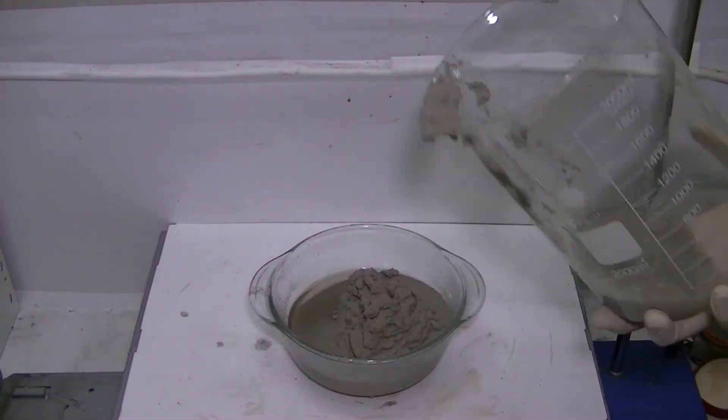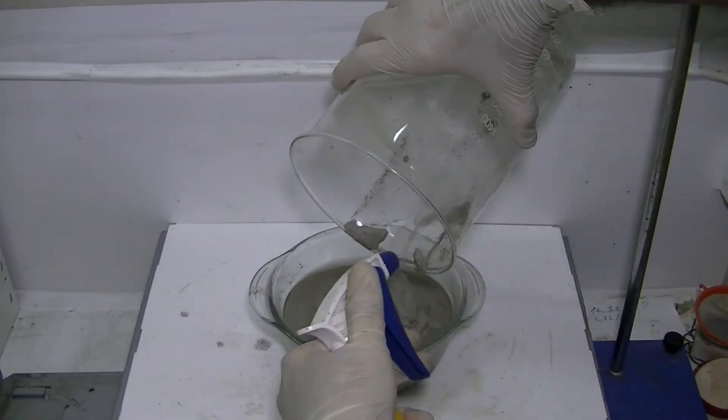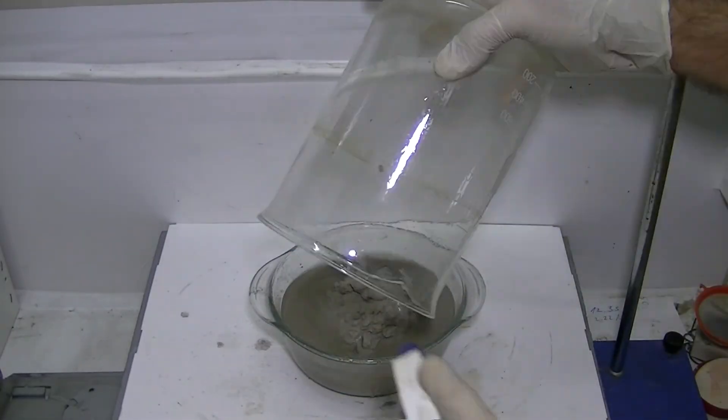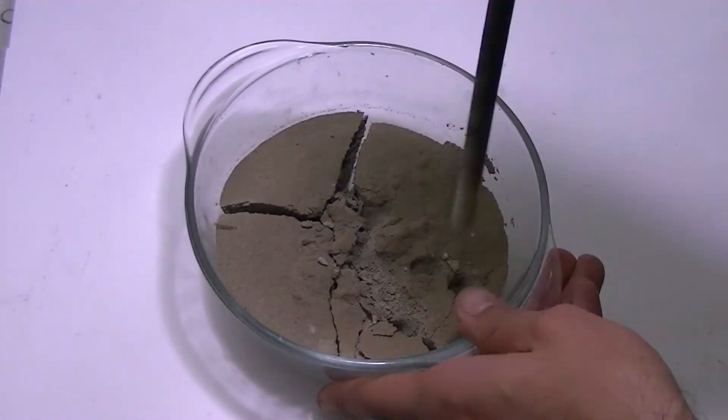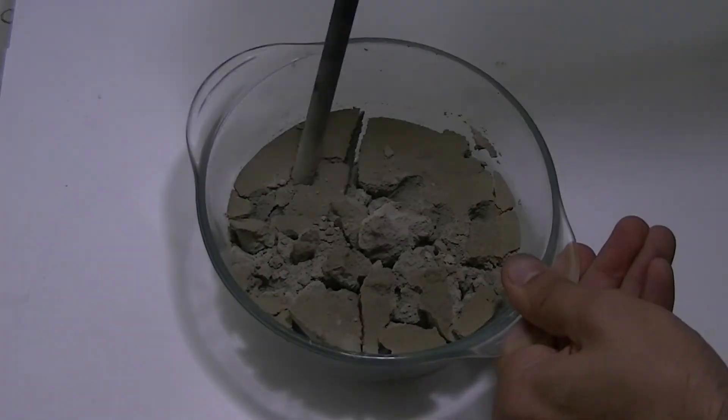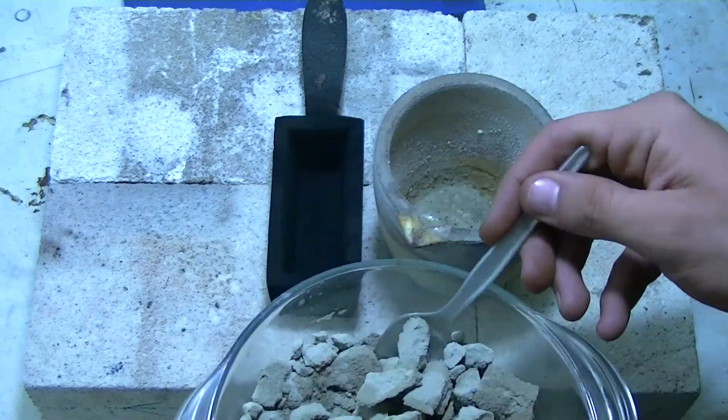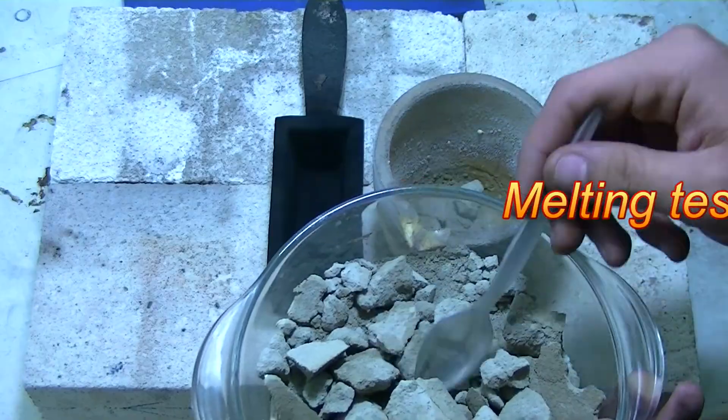The pure silver powder is transferred to a shallow and wide dish to dry thoroughly on low heat. The silver powder is out of the oven and is ready for meltdown. Let's melt a small sample to see how our silver turned out.